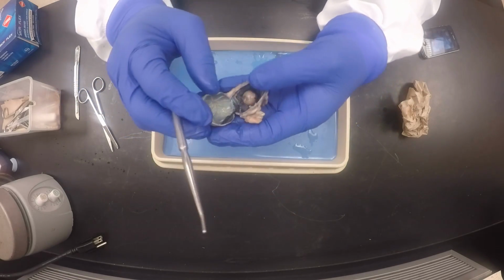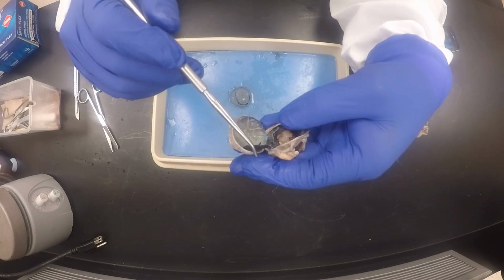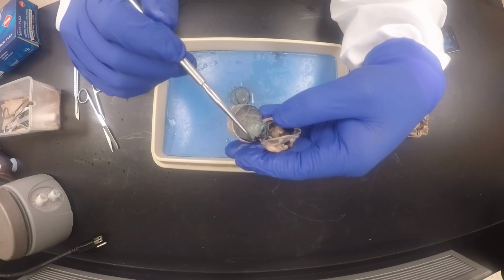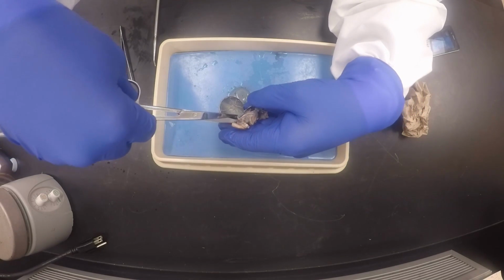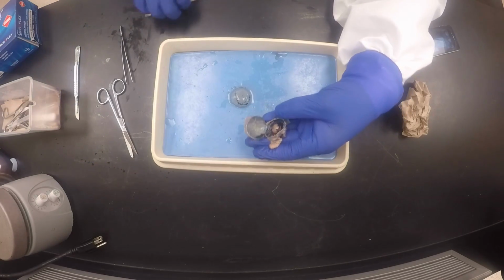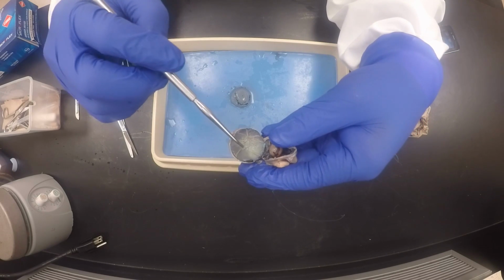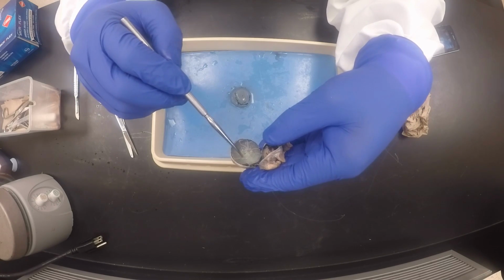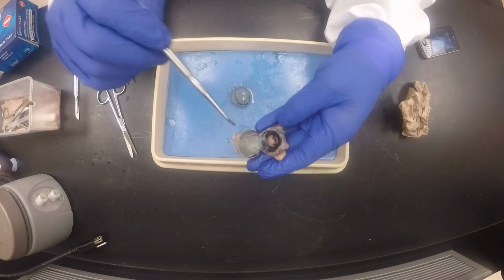Towards the back here, you have the sclera, which looks like a tennis ball, the whitish connective tissue, and the black layer is the choroid, part of the vascular tunic that provides the nutrients. I want to make a little cut here. Then, like I was saying earlier, this creamish part that looks like cream cheese is the retina, and the retina has to be flat against the choroid. If we were lucky, we would have seen the macula somewhere here, a darker yellow spot, which is the fovea centralis where light is focused.